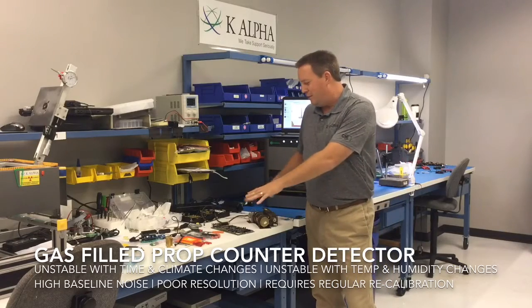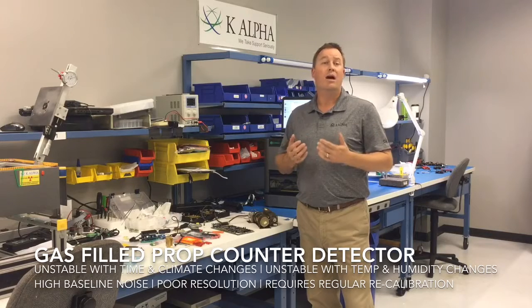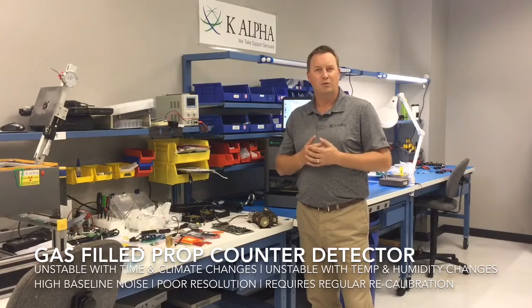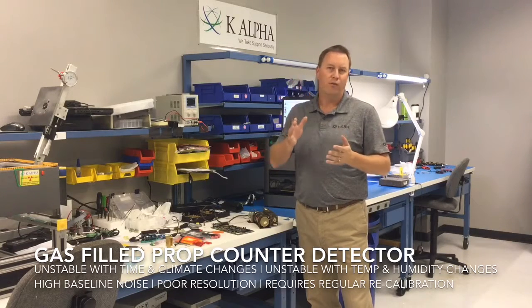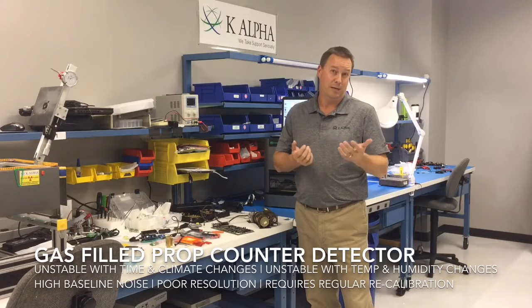All of the wiring and the signal conversion adds up to a lot of noise. You get a high baseline noise. You also get very poor resolution. So neighboring elements like nickel and copper really overlap badly. Sometimes you have to use secondary cobalt filters to separate some elements.